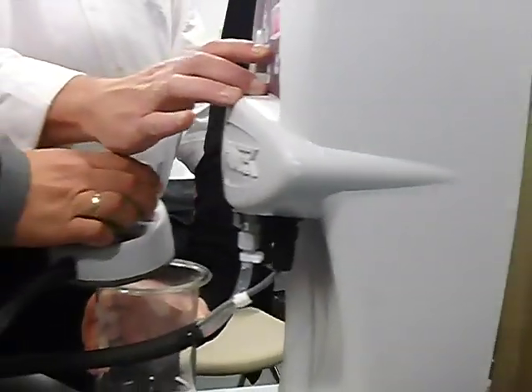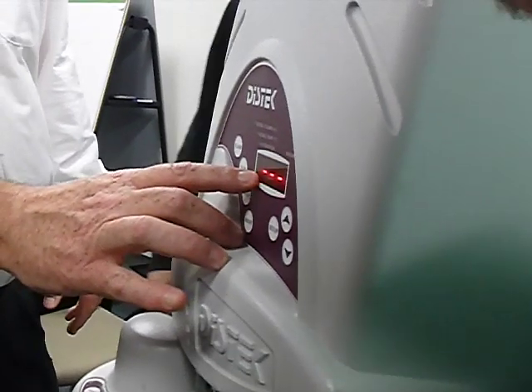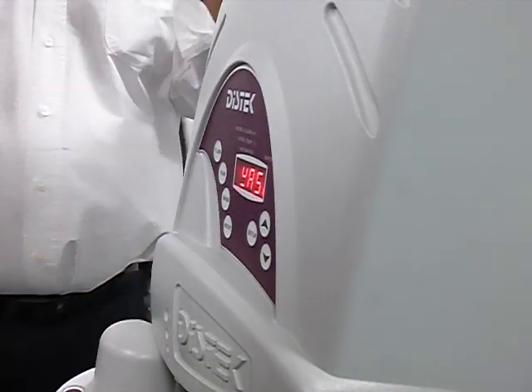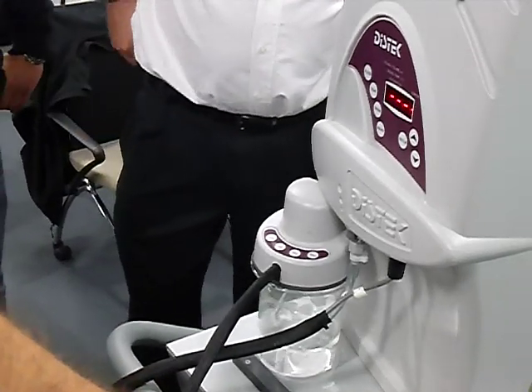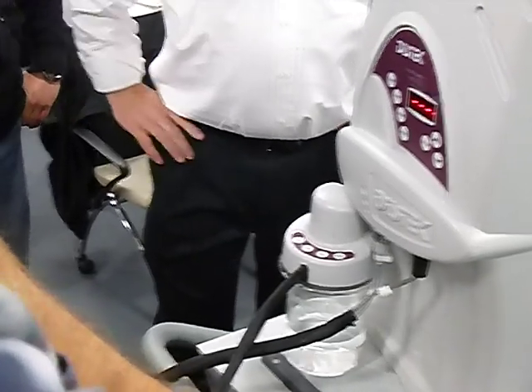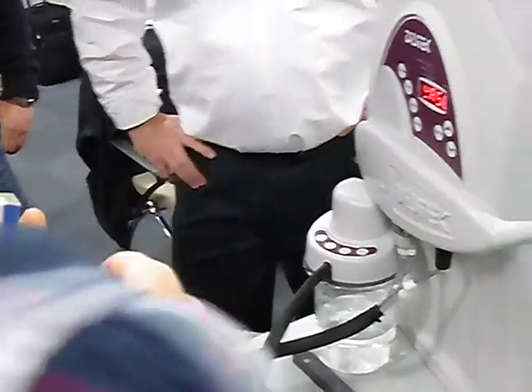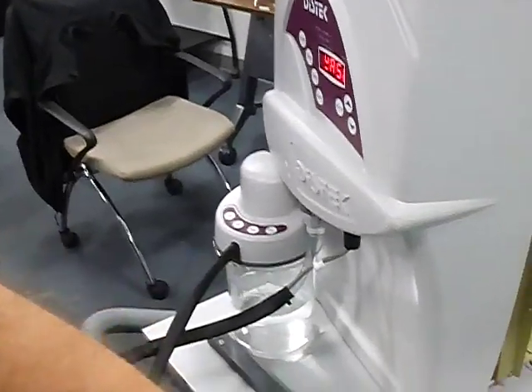Reboot it? But I think we need the beaker. Yeah, here it is. All right, that means wash. See the Y there? Because you can't make a W with those characters, so they put a Y there, so that means wash. Okay? Yes, wash. So there was no way they can make a W out of those characters. I think it means waste. Yeast. Yeast, wash. And you know, beaker.